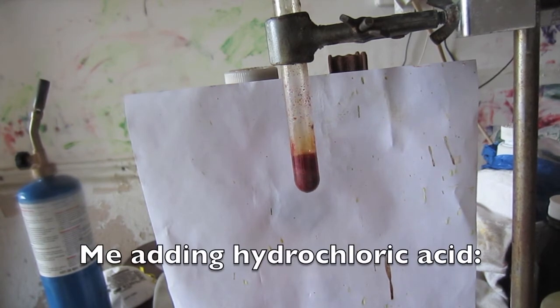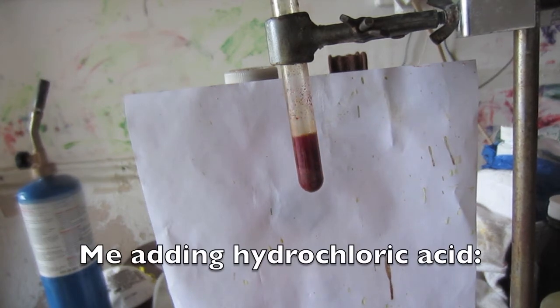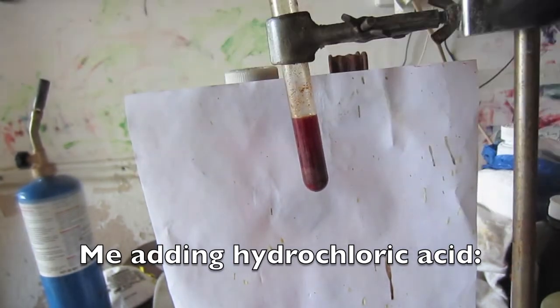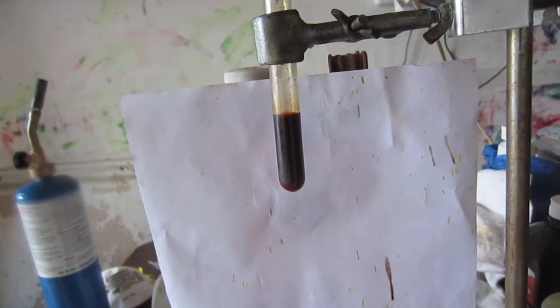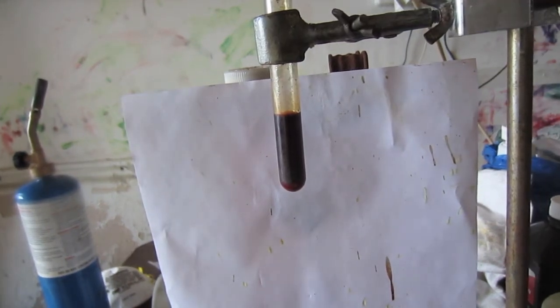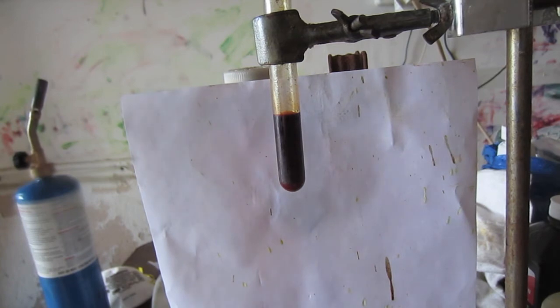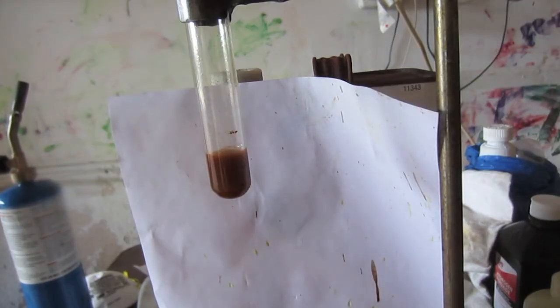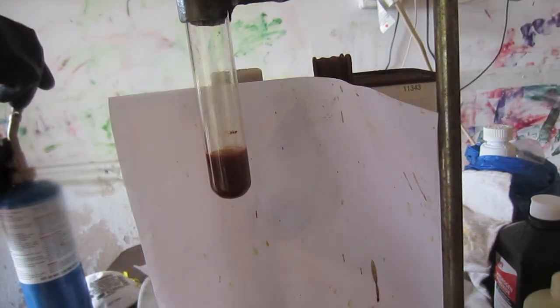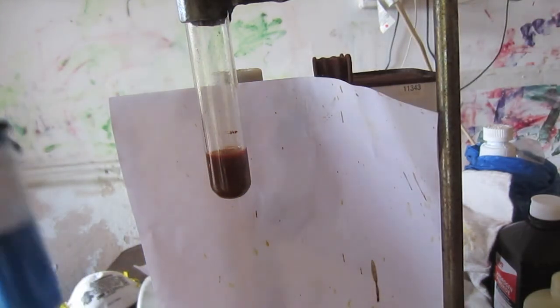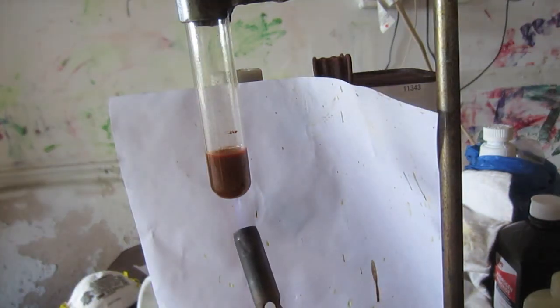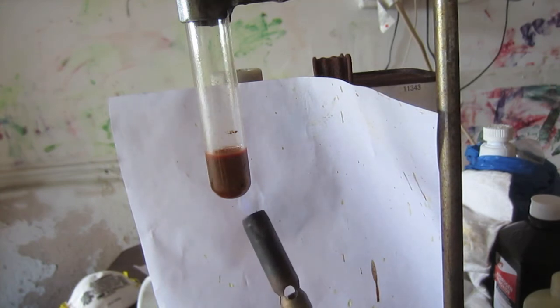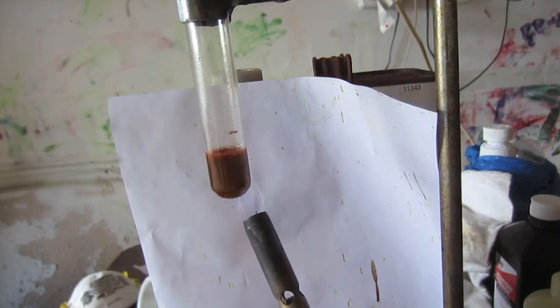That is why I am doing this double displacement reaction, so I try to get vanadium trichloride. The reason I cannot just react to start with vanadium trichloride is because vanadium metal will not react with hydrochloric acid. That is why you need to have this intermediate step. You should add about that much hydrochloric acid. Now I have decanted off that extra stuff because you have to boil this solution. So you can boil it in stages, or just decant off that amount, and then start to boil this amount.